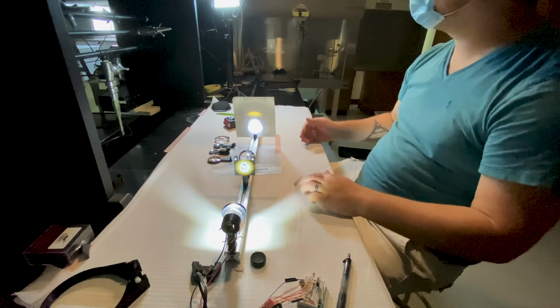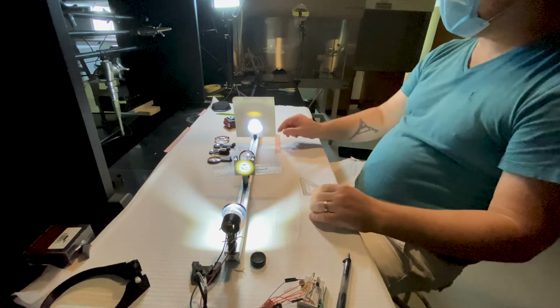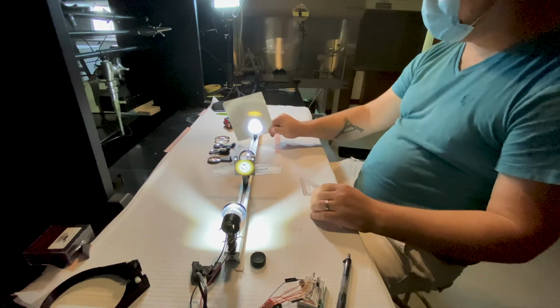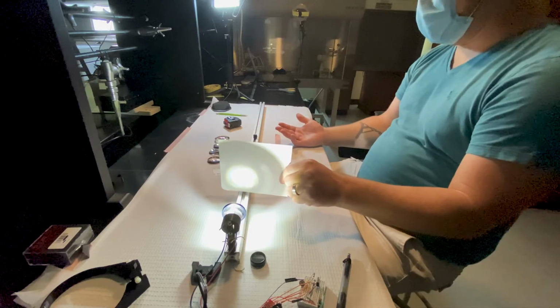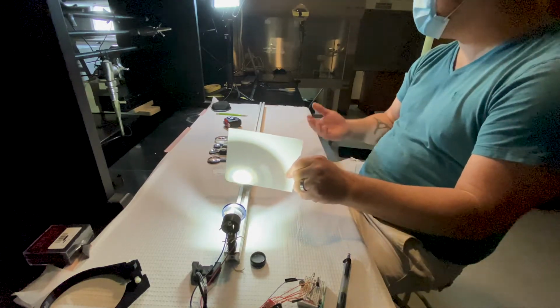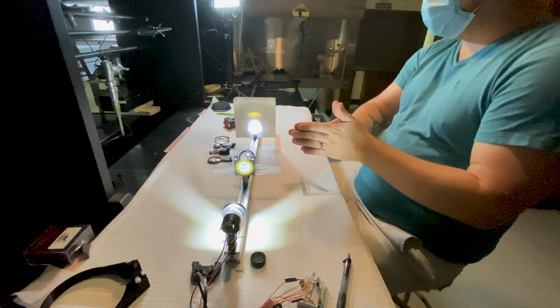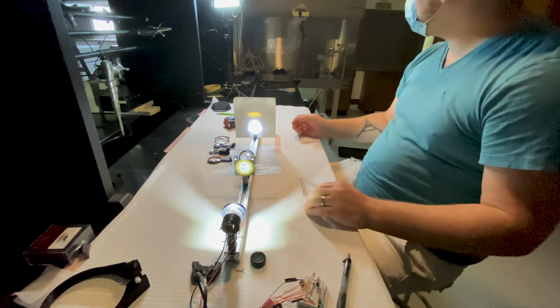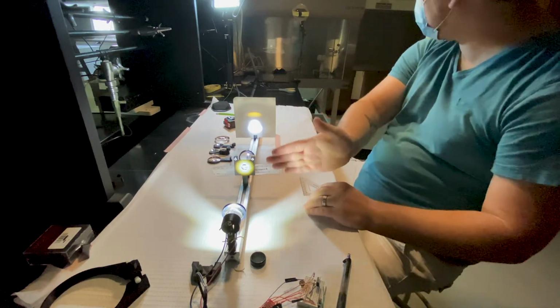This is a little bit tougher to demonstrate with a setup like this, because I can only sample planes outside of this. As soon as I try to sample a plane over here, I just block out my light, and I'm not going to be able to see any images formed there. Additionally, the image is virtual because there really is no place in reality where those rays would converge to form an image. They would just appear to be forming behind the lens.